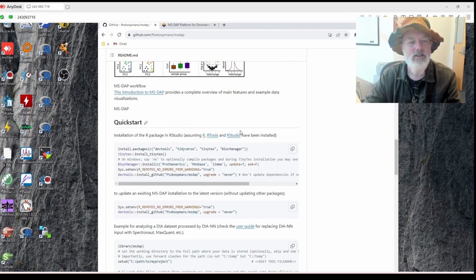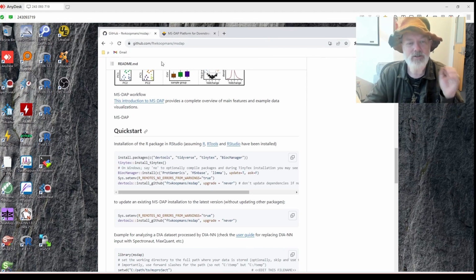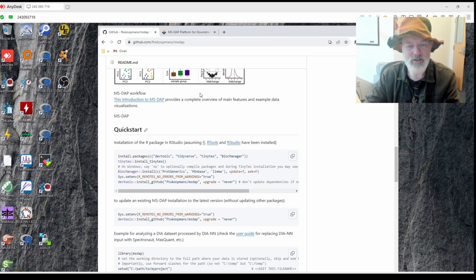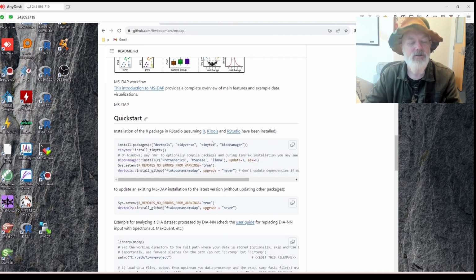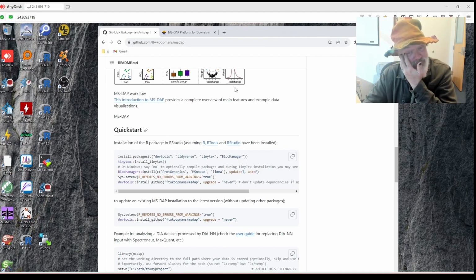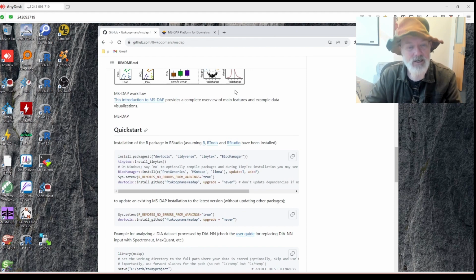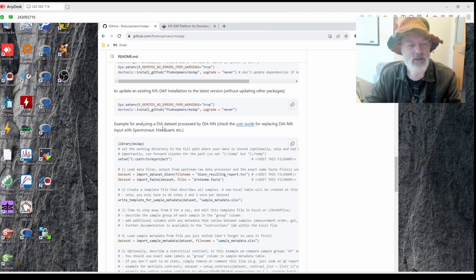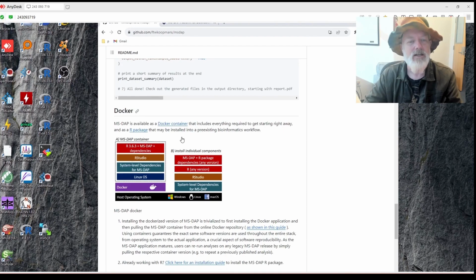It has really good instruction packages. I think the hardest part was actually installing RStudio. So if you don't have RStudio installed, you have to download R and you have to download RStudio. It's not too bad, but if you don't have admin privileges on your computer, it can be a little harder. For those of you who like to use a container system, they also have a Docker container.